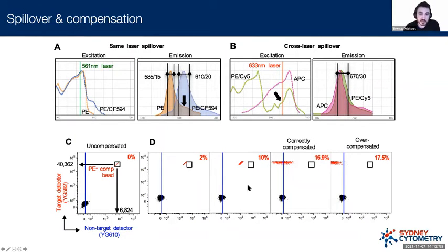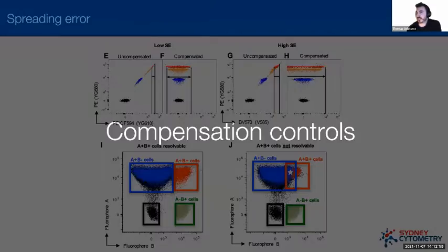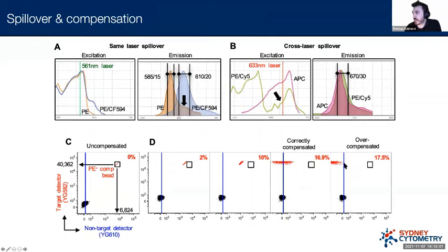And then, of course, if we keep increasing this value, we see that this will keep going. Oh no, it's all coming apart. If we increase this value, we can see that this goes further and further, and in this case we would call this overcompensated, which is also a problem. So this is something that we have to tackle and something which is really important.